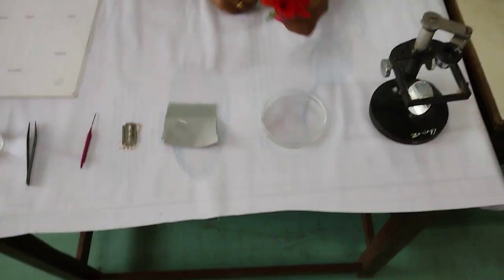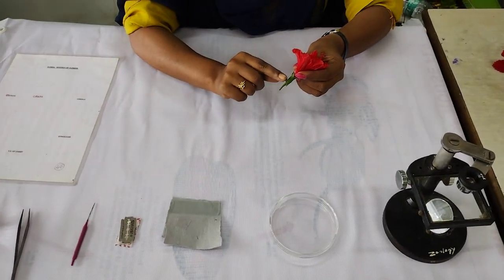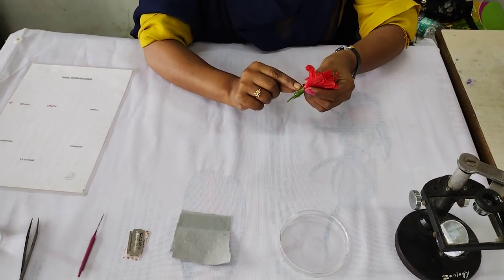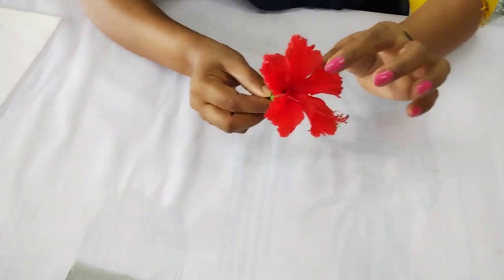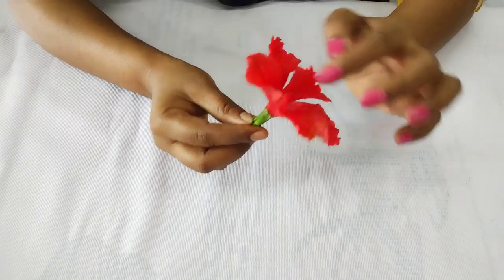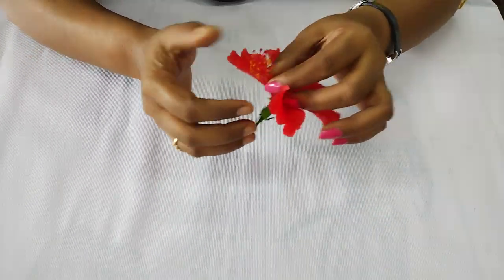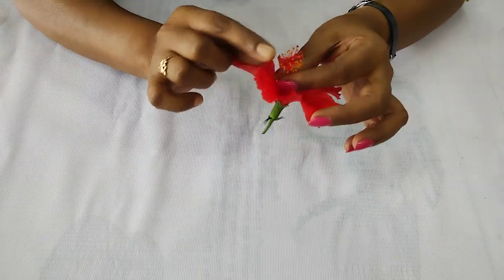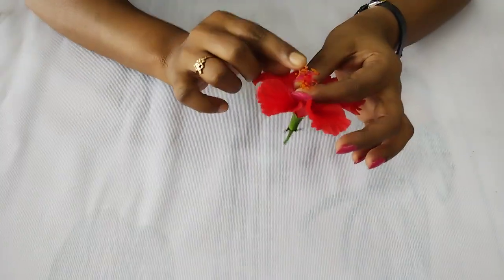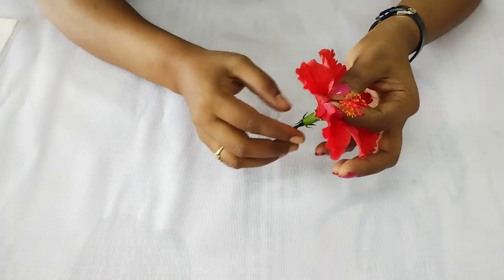This is the China rose. The small outer part is called the epicalyx. The green part is the calyx, and the bright red part is the petals, which form the corolla. It contains the gynoecium and androecium, making it a bisexual flower. The yellow stamens are many in number — this is the androecium, and this is the gynoecium.